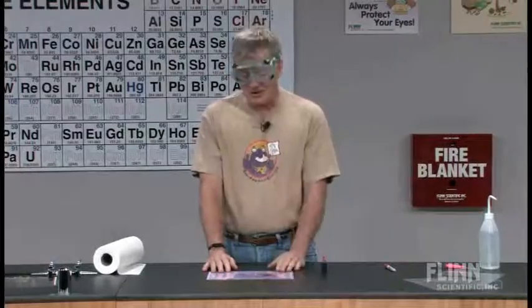Again, it's a nice, simple demonstration. Takes no time. I'll do it just like this in first period. I will have lost this by second hour, and I'll make another one. And I can continue with it. I don't use anything that's really expensive. It's easy to do. It illustrates one more part of the safety rules and safety procedures that we set up in our classroom.